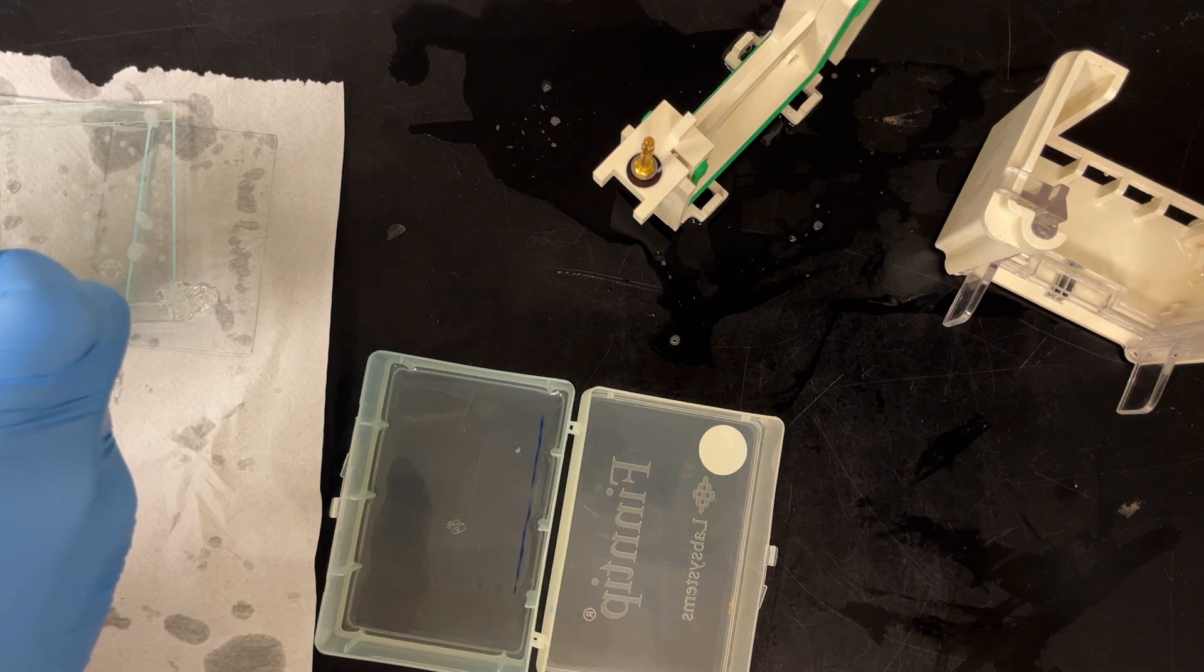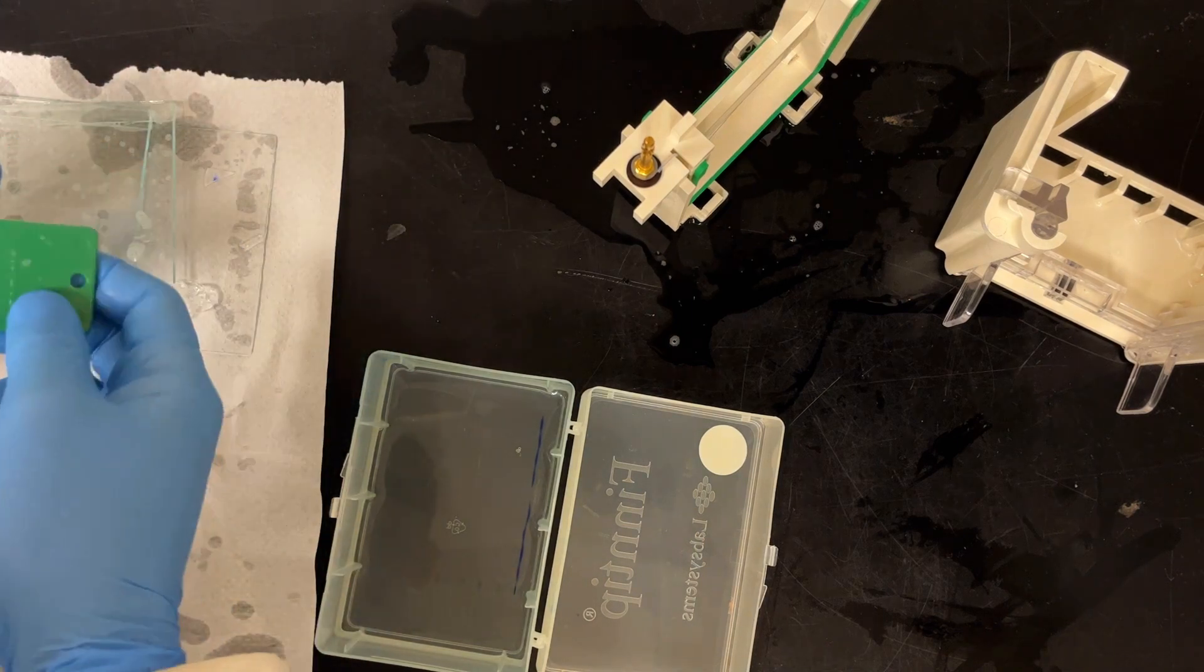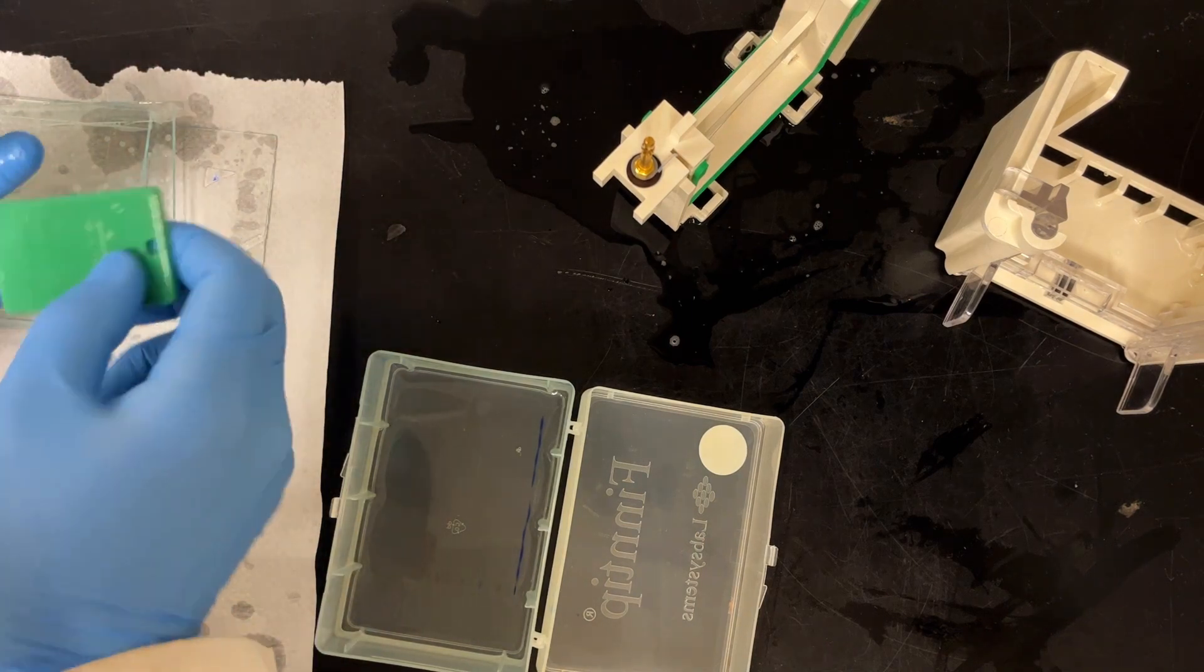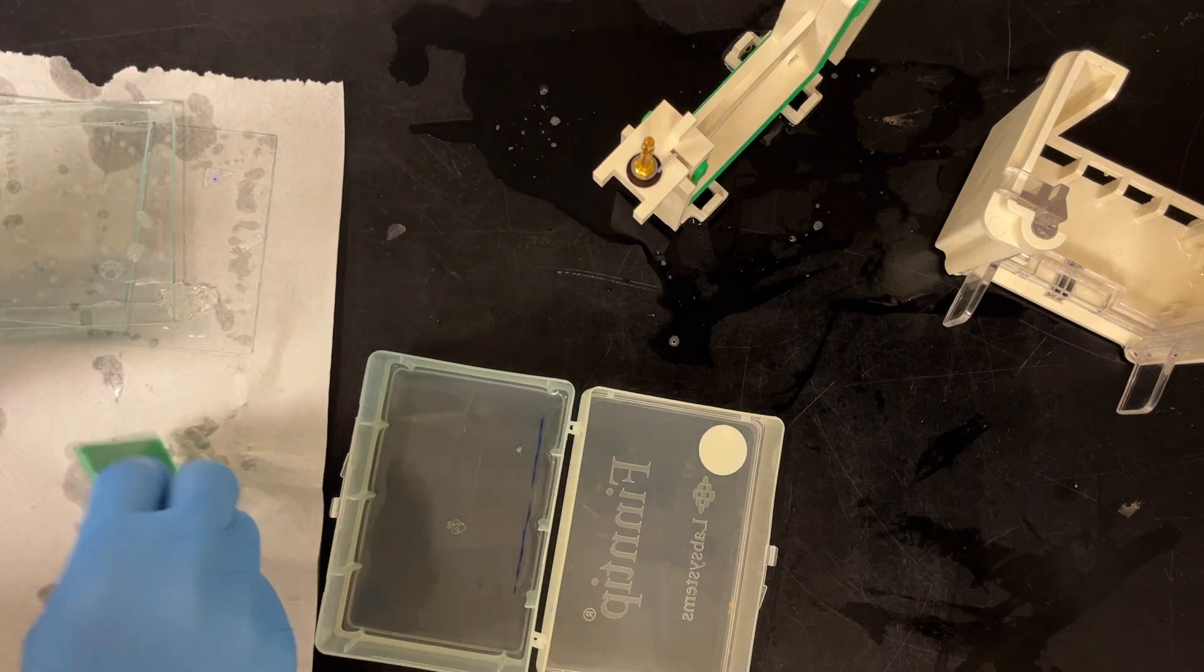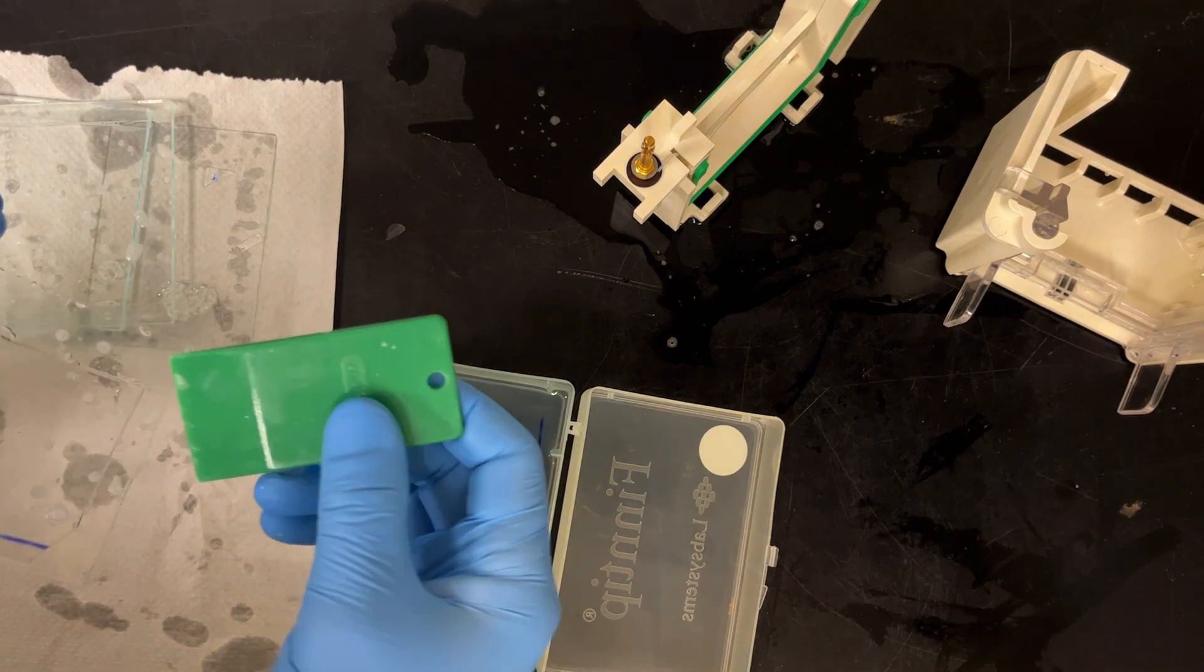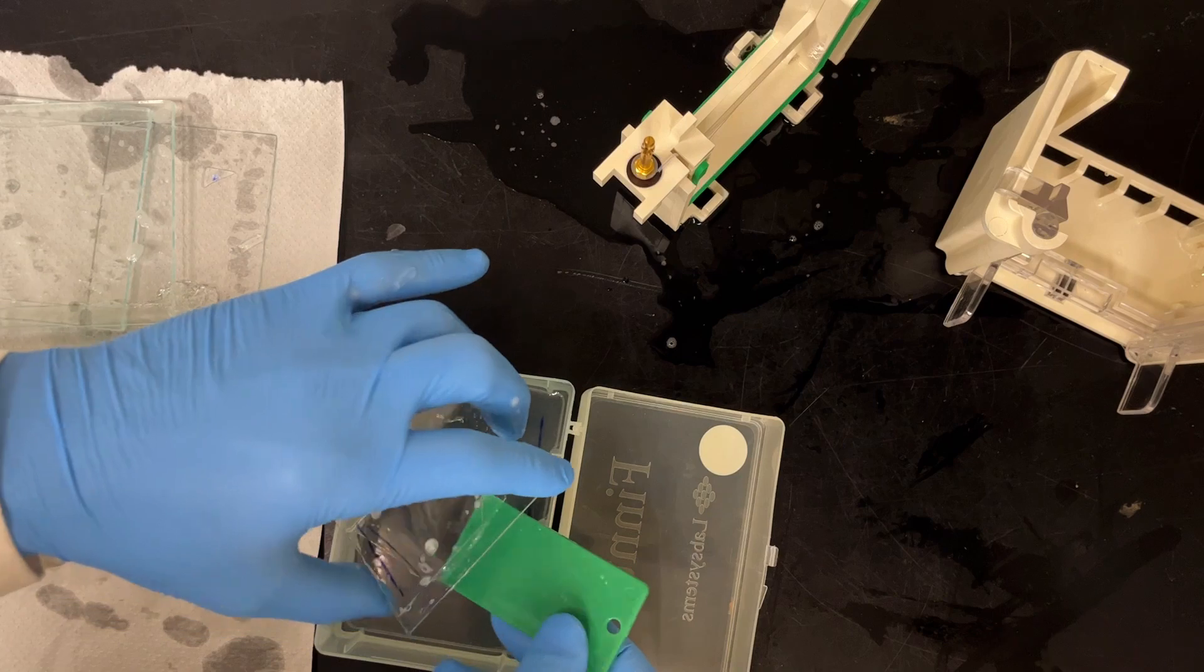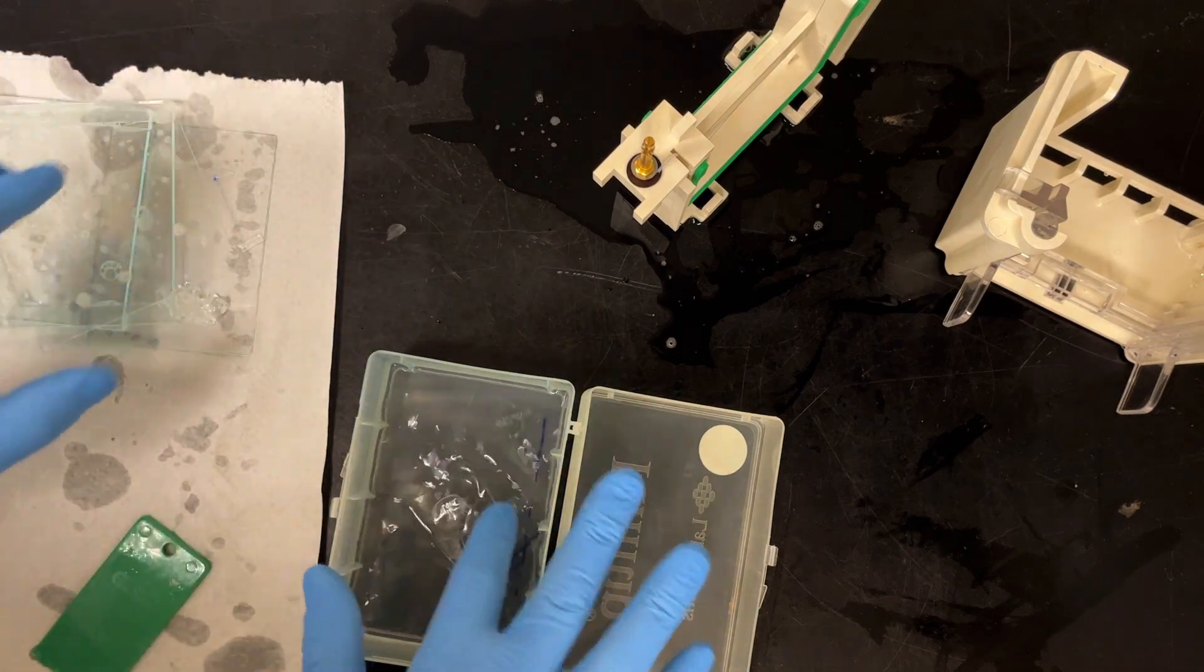Oh, I'm off camera. Did I remember to go back on camera? Come on, get back on camera. Bottom right. So I notch top left, bottom right, so then I can orient my gel. And then simply wedge underneath and let gravity do the work as it falls in. Nice and simple.